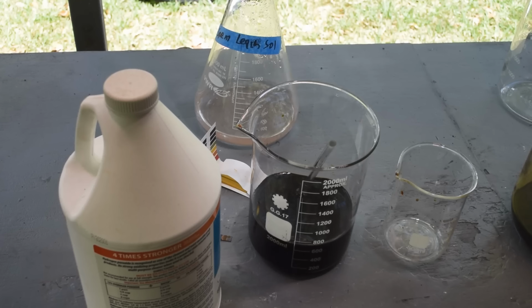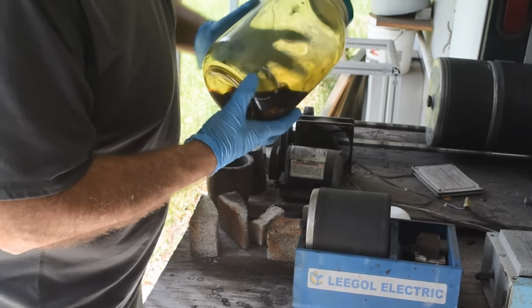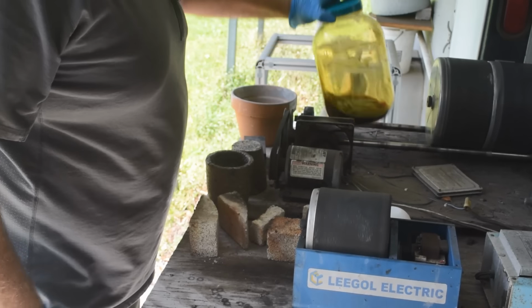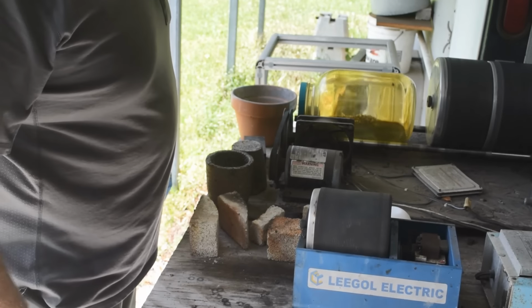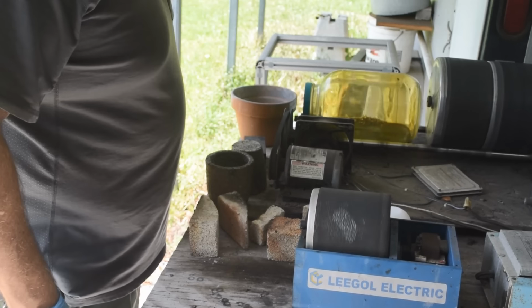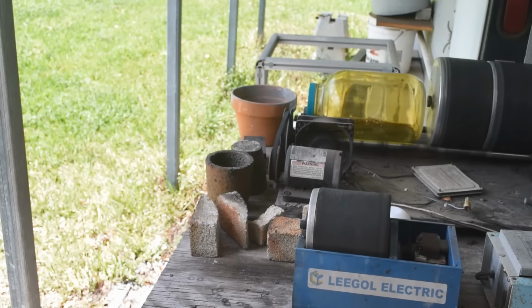I'm going to do 15 minutes each treatment and see how well that works. All right, so it's now 2:08 p.m. And just in the time it took me to walk over here to the rock tumbling station, the pins have started looking dull. So I would say it's working. Not getting as much agitation as I'd hoped. You can spread them out a little bit. I don't know. I think I need ribs or something on the inside of the bottle. There is some agitation, but it's not great. But you know what? We're going to press forward with the experiment.